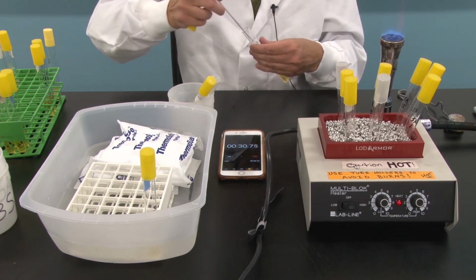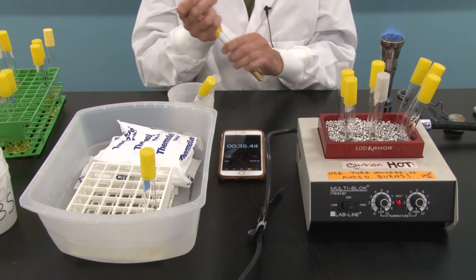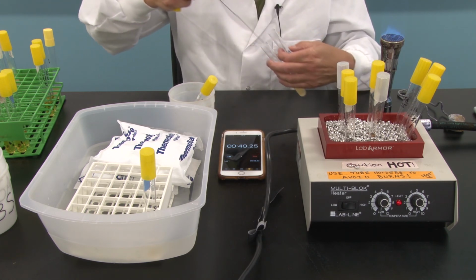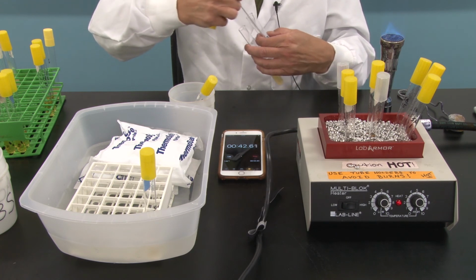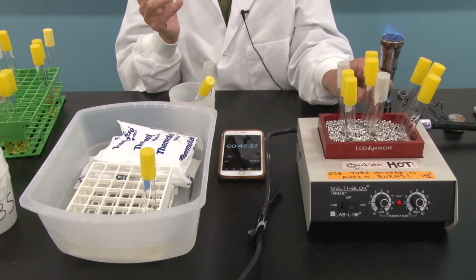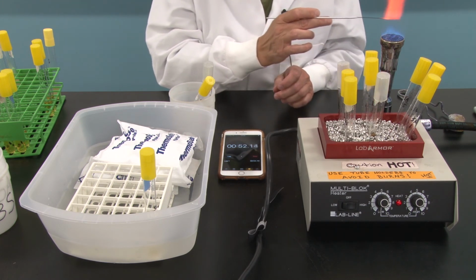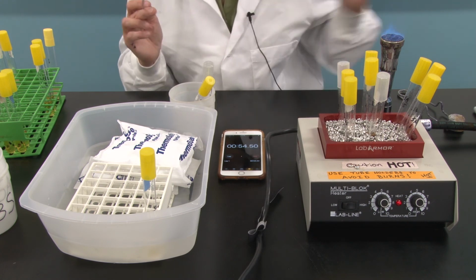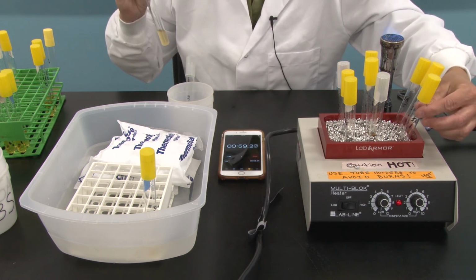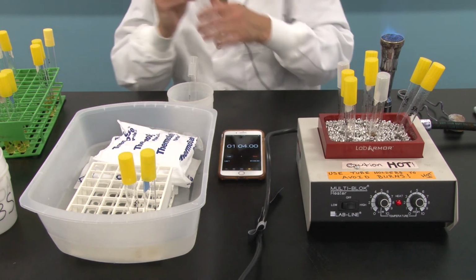Five-minute. Watching my timer because I'm going to have to remove, here in a second, the 1 minute Staph aureus tube. Okay, so now those E. coli tubes have been inoculated. Flame my loop. I'll wait to do the Bacillus subtilis here because in a matter of seconds I'm going to have to take the Staph aureus out. Okay, and put that in the cold.